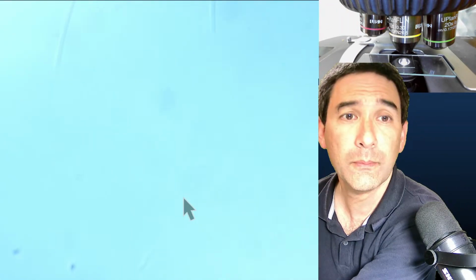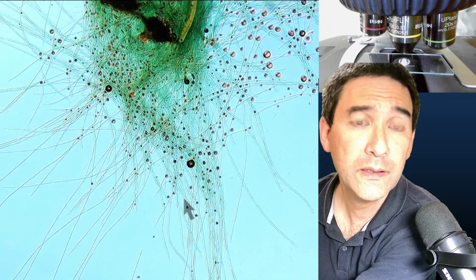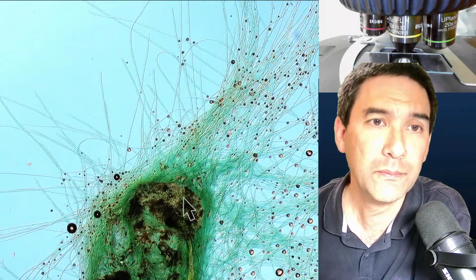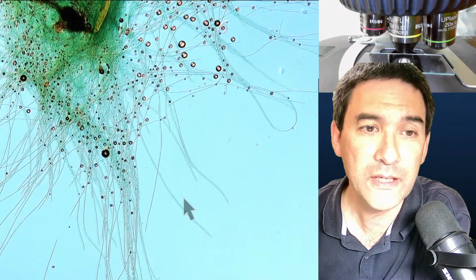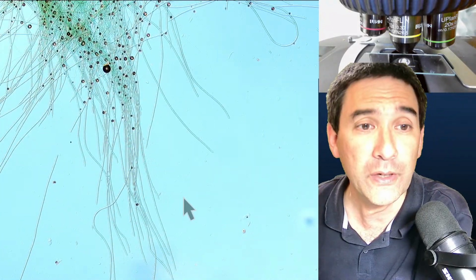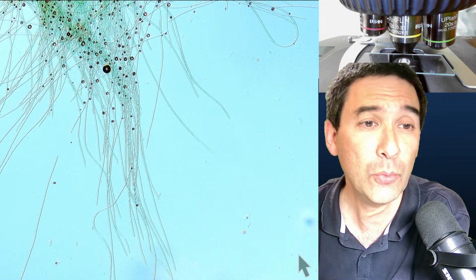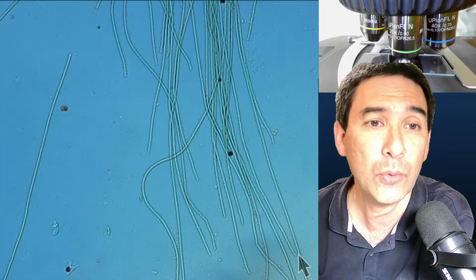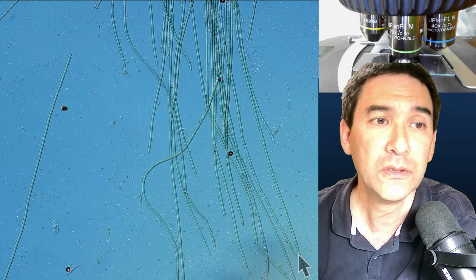I have to find again some... Yeah, bubbles, maybe, but ignore the bubbles. But I think you do see that essentially the image quality overall looks much better, and especially in the background, you don't see these dots anymore and so on. So why is that? The reason is because the difference in refractive index to the mounting medium is not as big anymore, right? And for this reason, the image simply looks much cleaner.